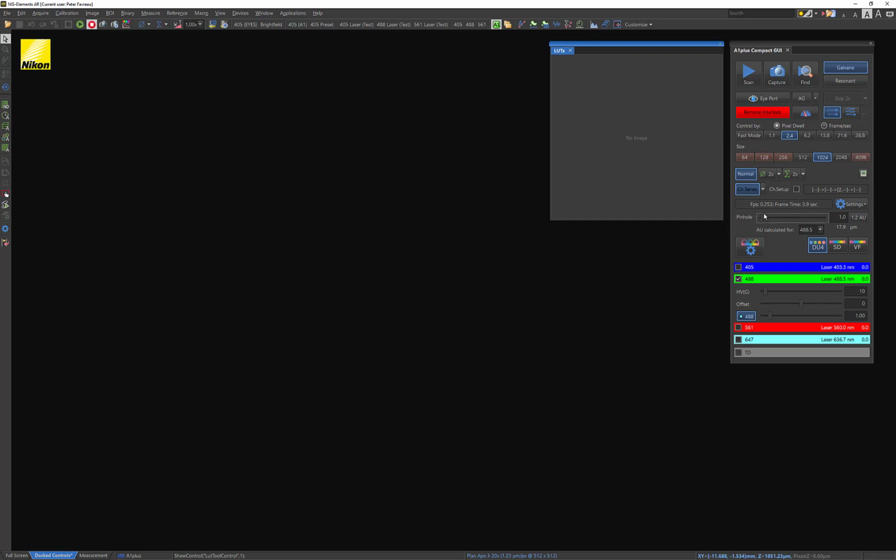I think there are many settings that will affect the number of detectable photons, but probably the two largest ones can be found in this A1 Plus Compact GUI under your channel settings. Both the gain, HVG here, and the 488, this laser power, are going to give you the two highest bang for your buck settings. This gain here refers to the detector gain. So you can think of this as it detects more photons at the end of the optical pathway. So this works sort of on the other end of the imaging experiment, where you can bump up artificially the signal that you're detecting with your photomultiplier tubes.